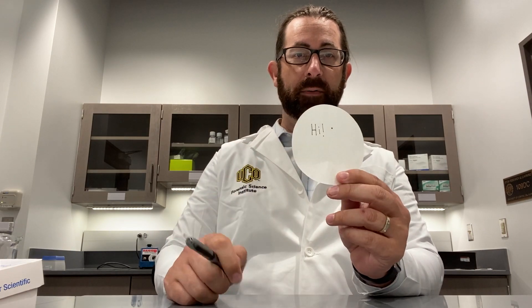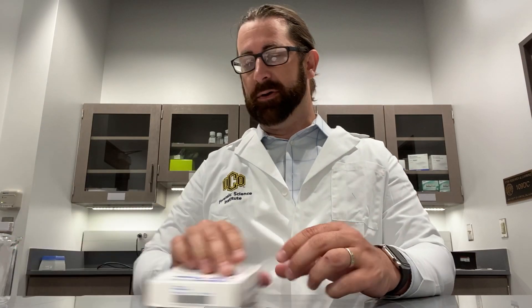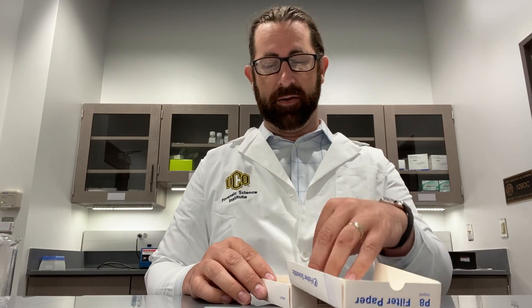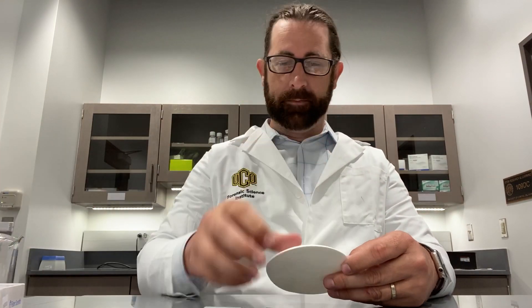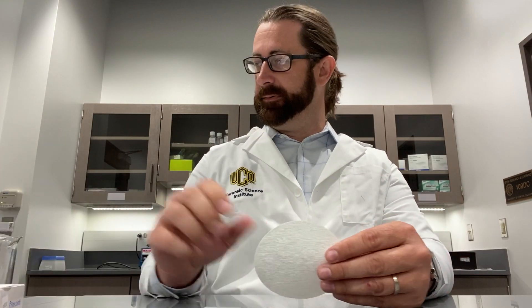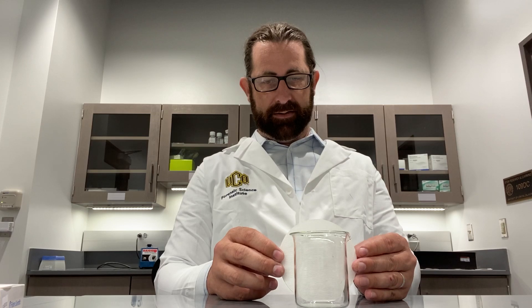So this is going to be our crime scene, and this is what we have to compare to. We're going to set this aside for right now. In order to set up this experiment, we're going to take some filter paper. I'm going to grab a few sheets of this, grab my container, and I'm going to try to measure a little bit.